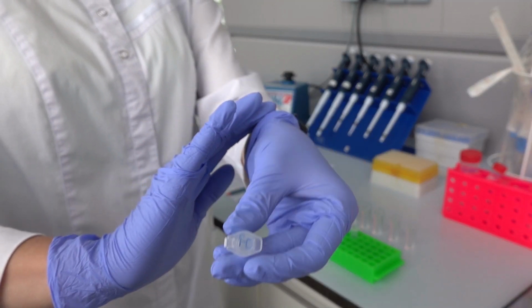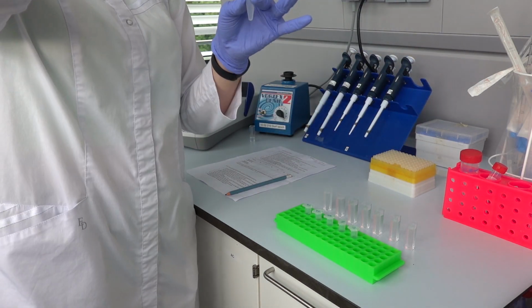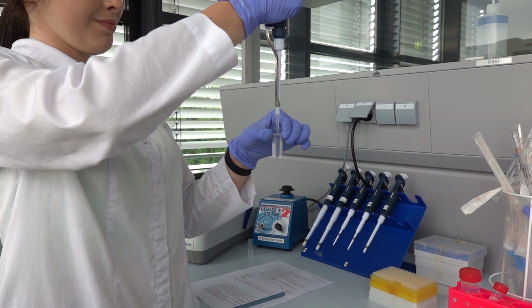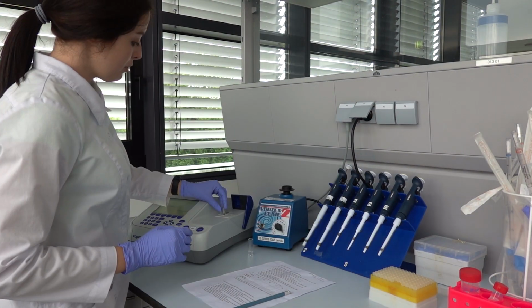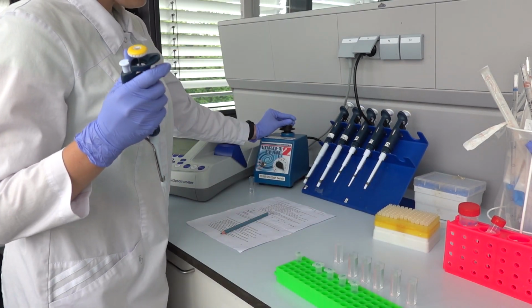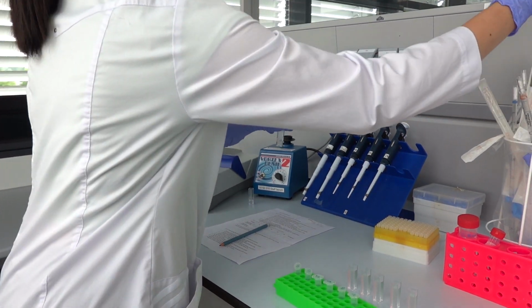Then 40 microliters of lysozyme as a positive control and each fraction from F0 to F4 prepared in the previous units were added to the cuvettes. The initial absorbance for each is immediately measured after adding the enzyme, and the timer is set up to let it incubate for 5 minutes at room temperature.